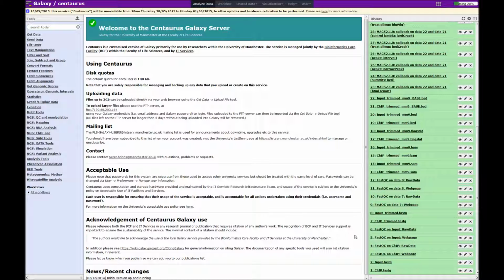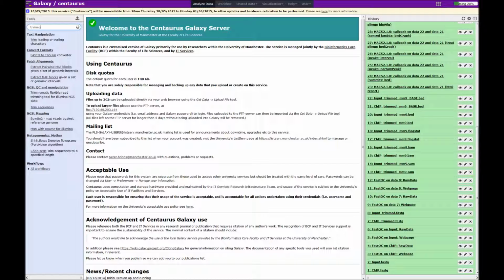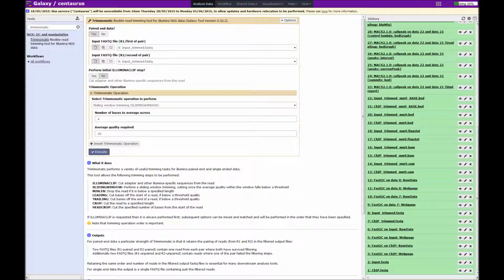The eagle-eyed among you may notice that this history has changed because I accidentally left out the trimming step. Let's go ahead and find Trimmomatic from our list of tools. Again, we'll use the search toolbar to find it. So Trimmomatic. Here we go, under NGS-QC and manipulation in this case. So we click on that. Okay, so here we have the interface for Trimmomatic.